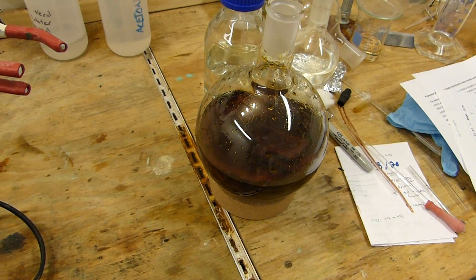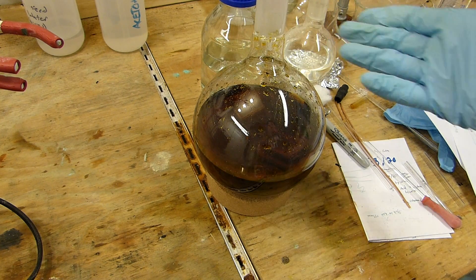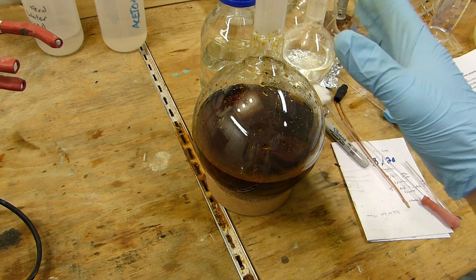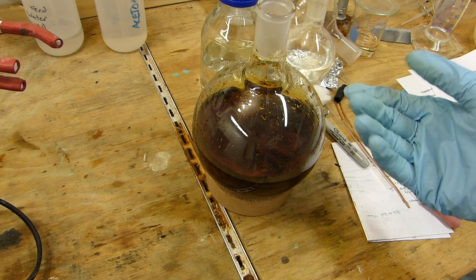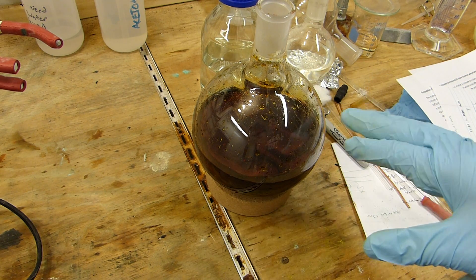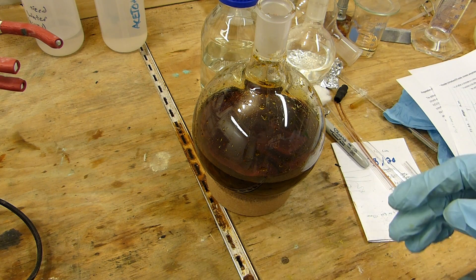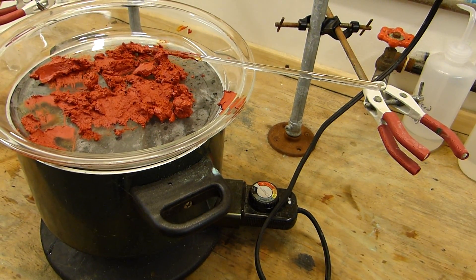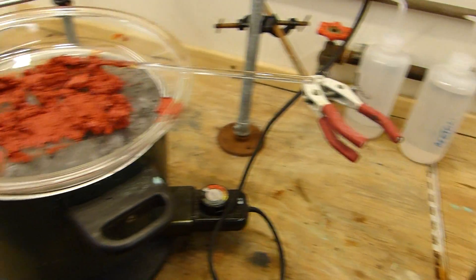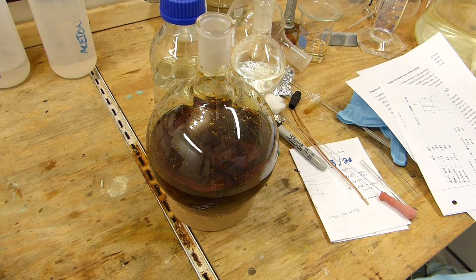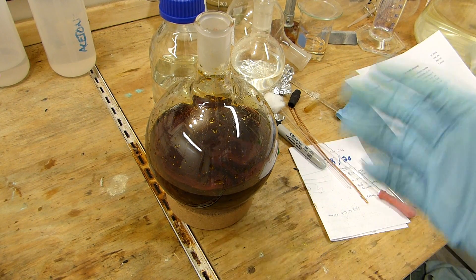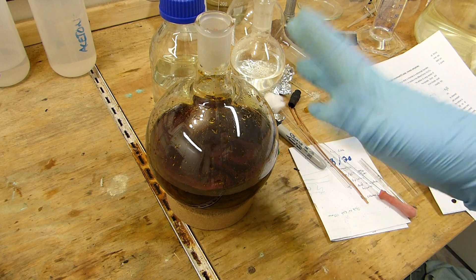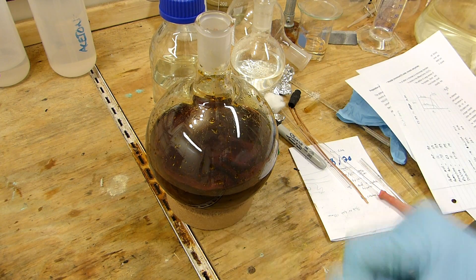There is an issue as of what to do with this, which is a whole pile of about 75% sulfuric acid, a little nitric acid, and a whole bunch of chromic acid essentially. Don't throw this out actually. You could neutralize this and throw it out if you really wanted to, but save it because this is excellent at cleaning glassware. If you've got a crudded up flask, it's got carbon deposits, I don't care what's in it, this stuff works wonders at cleaning. Chromic acid itself is often stocked in laboratories, or once was, because it's so good at oxidizing things and you can take carbon out of a flask with it. It's not really used anymore because of the EPA and hexavalent chromium released to the environment, which is bad. I'm going to save this in a jar, and whenever I need to clean some really cruddy glassware, I'll just run some of this through it and clean it up no problem.